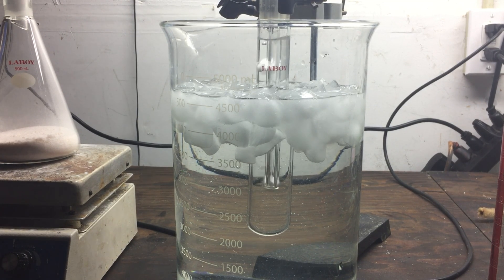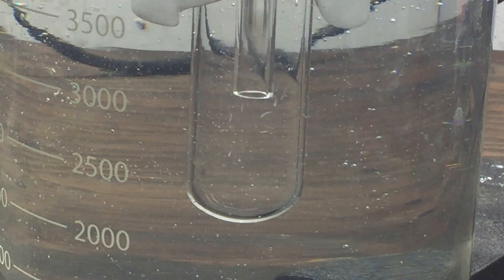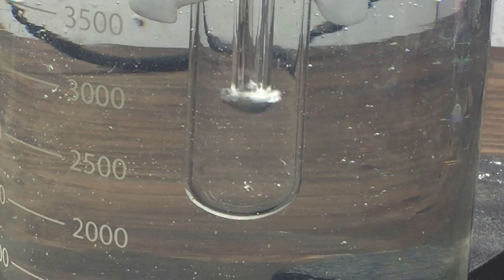And here you can see the ammonia being produced. In the end, there will be about 24 grams of this gas that are released into the solution.